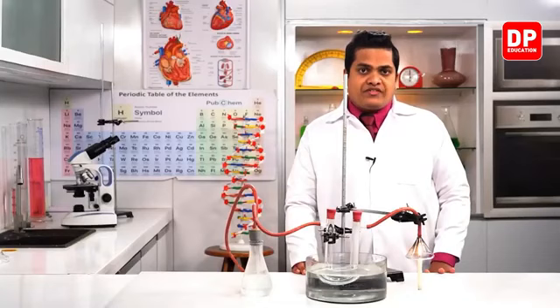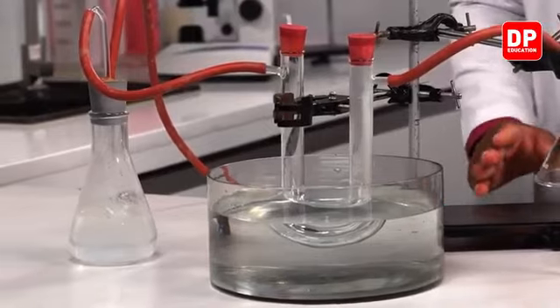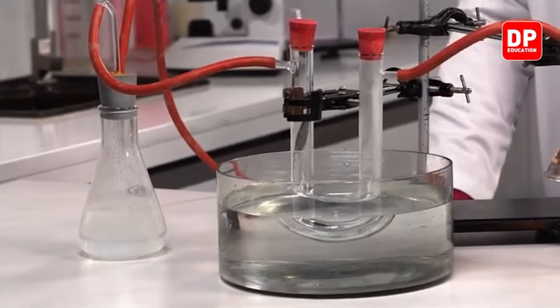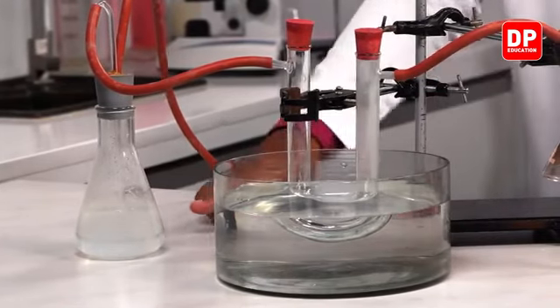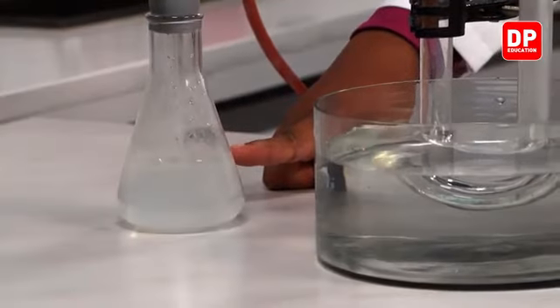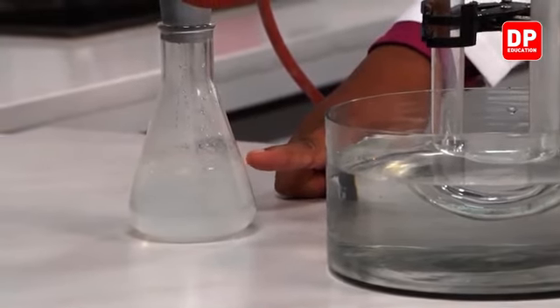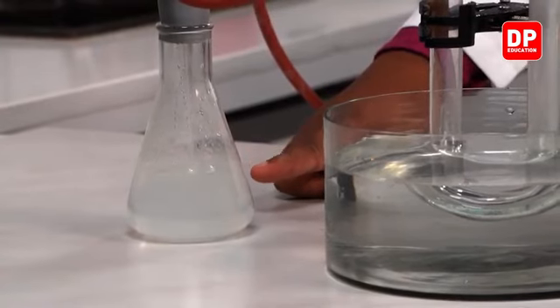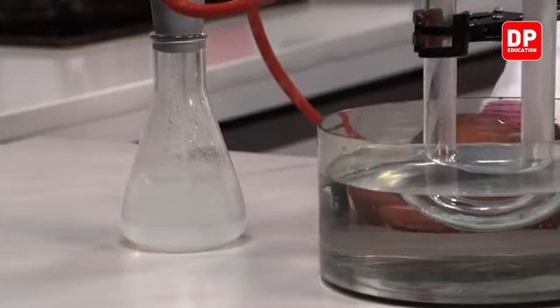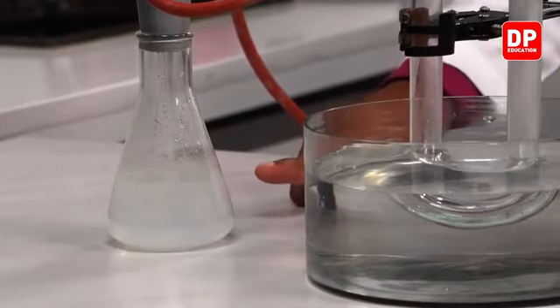So we have to give it some time, right? So that the products which are getting created during the combustion of the candle come in contact with the chemicals. Here you can observe that gradually the color of the lime water solution is getting converted into a milky white color. Can you see? When I was conducting the experiment, initially this chemical was in the system, the color was like the color of water. Now it has turned into a milky white color. Here you can observe it. See?